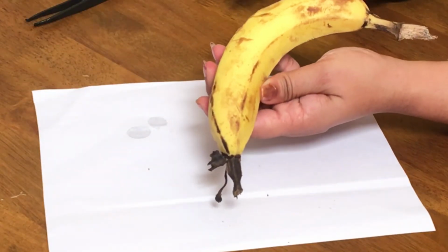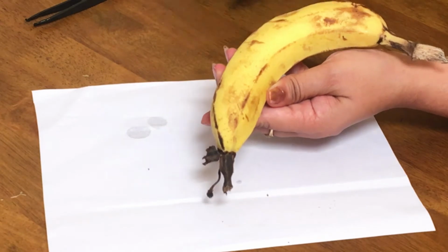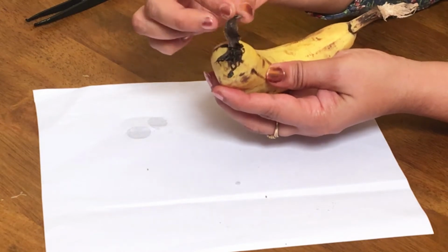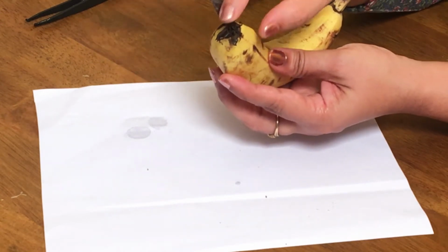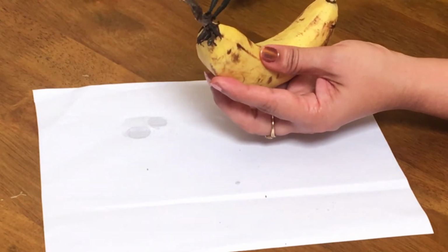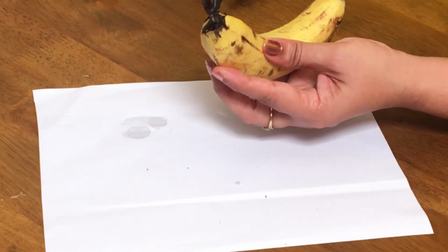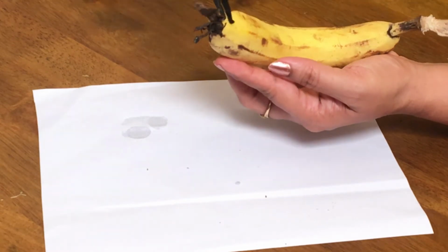This is a banana, which is a simple fruit. Why? Because this whole area, this fruit area, is actually the ovary formed from a single flower. This tip which you can see here, this dry part, is actually the calyx, persistent dried calyx, which generally falls off, and you can find some stamens here. These are the dried stamens, and this one is actually the style and stigma. So this is a stigma, this part is a style, and this will be the ovary.